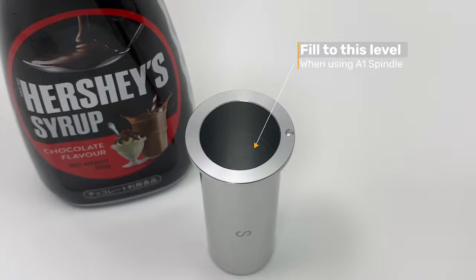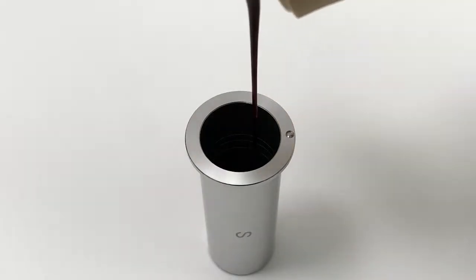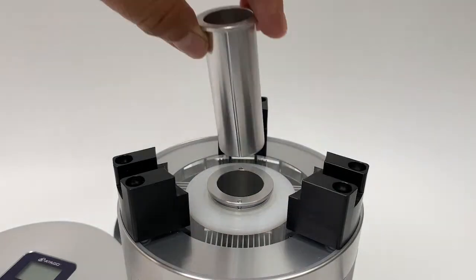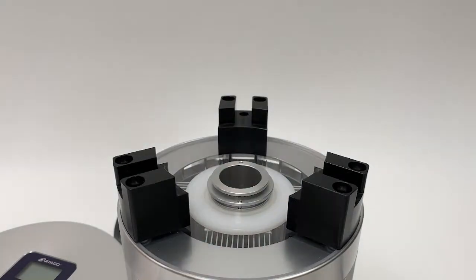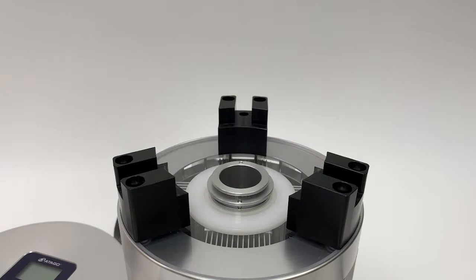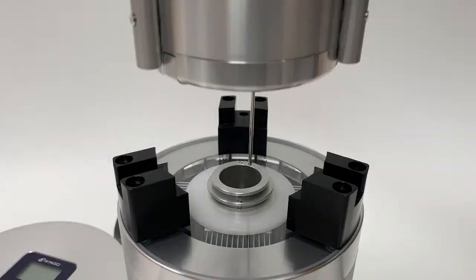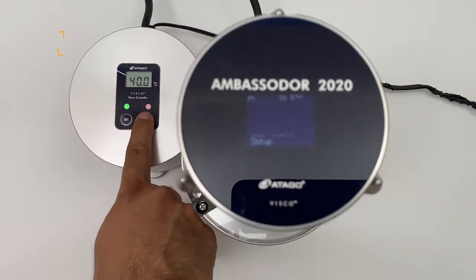Now here's the video of the chocolate syrup. Again, we're using the A1s spindle, so we fill up to that same line. This video shows more of the setup that the previous video didn't cover. We attach the temperature sensor and confirm that the chocolate sample is at 40°C.